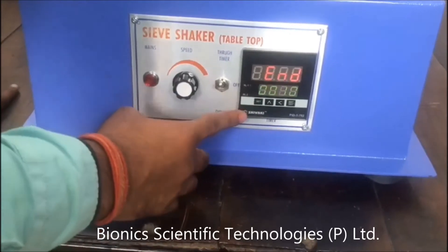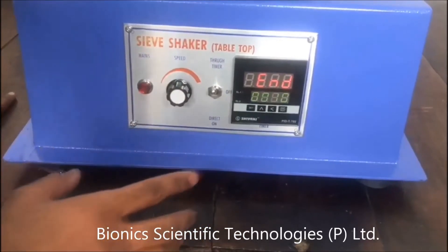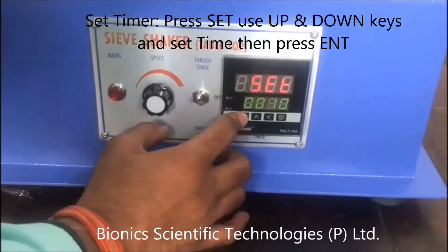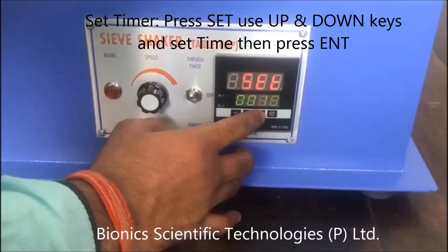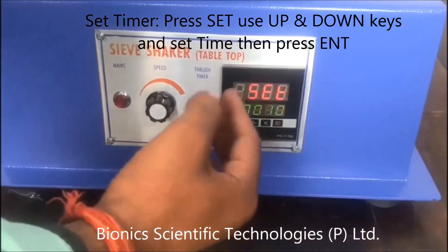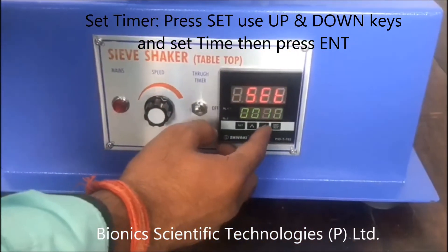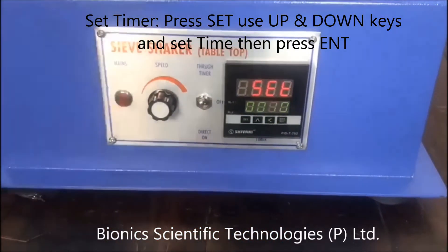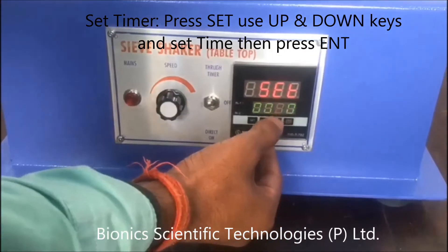You can start the machine like this. As you can see, the PID controller is on and the machine is working. To start the timer, first press the set button — the zero here is blinking now. For the minutes, suppose you need to set the timer at 20 minutes or 10 minutes, you can press this key like this.